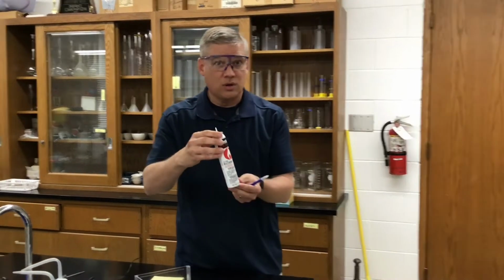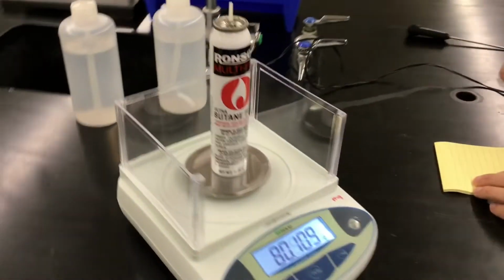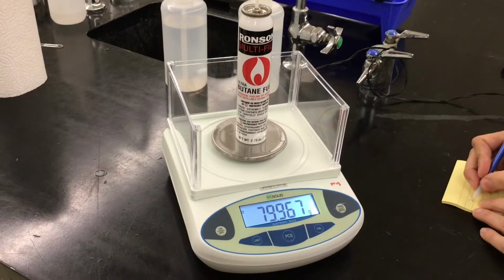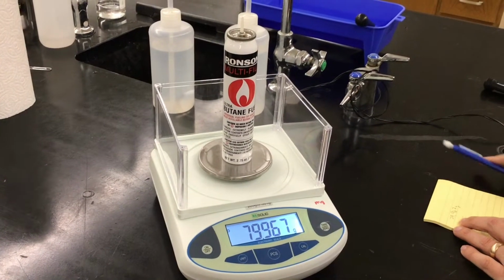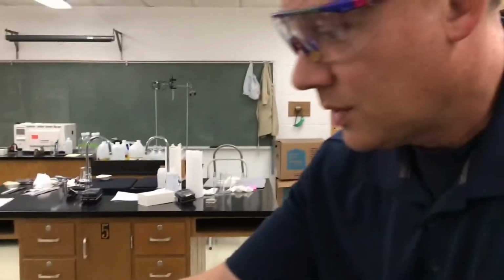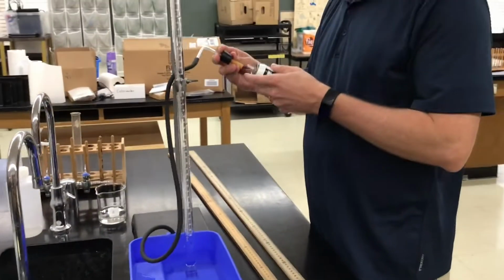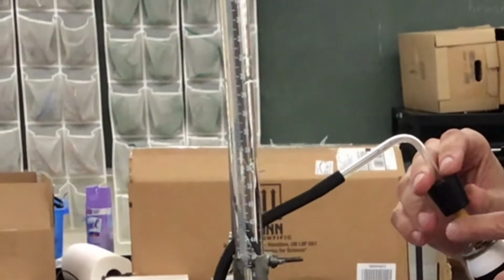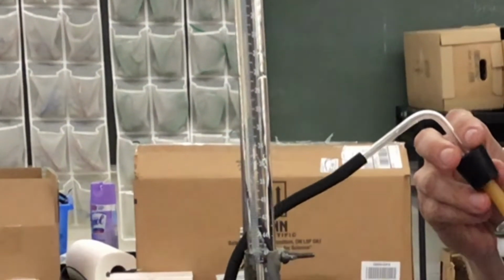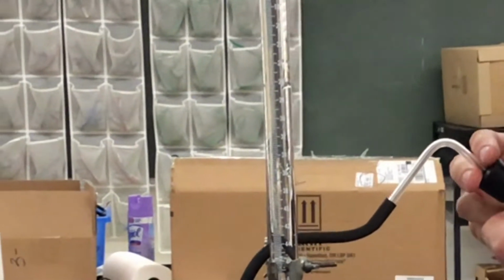Now come over here and we're going to find the mass of this canister, before and after. So the before is 79.967 grams. Ready? Okay, I'm going to go release it. I'm going to find the temperature, pressure, and volume of this gas. So hopefully I'm going to use my little tubing to release the gas inside the tubing. It's going to leak a little bit. That's going to be my major source of error. But let's pretend like it's not. Let's pretend like there's other error too.